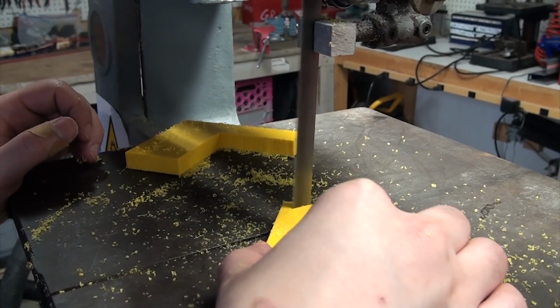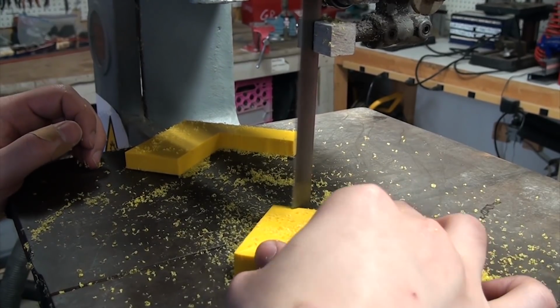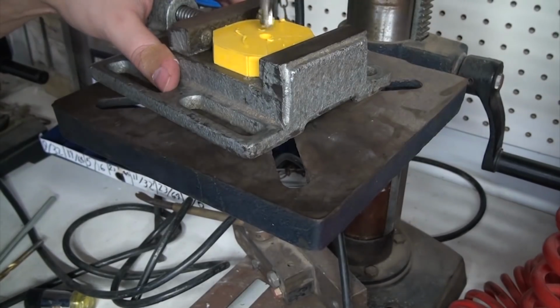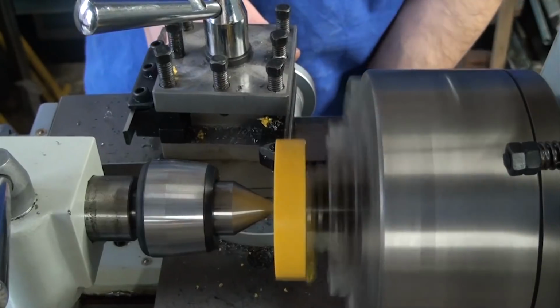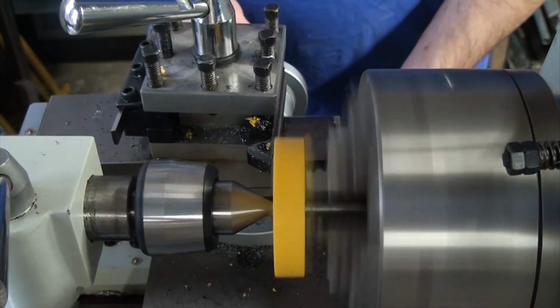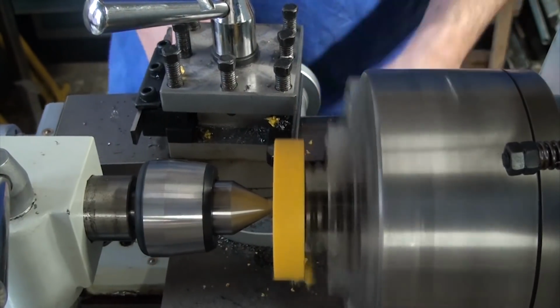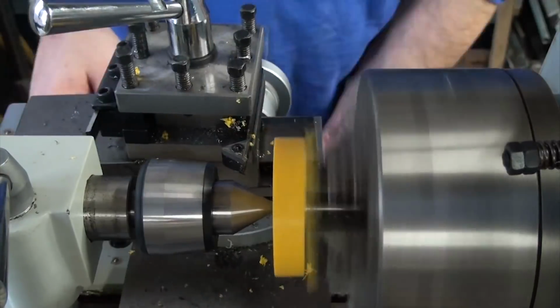For the top plug, I found this block of what I think is Delrin, but is probably some other hard plastic. I roughed out the basic shape and then made a small hole that doesn't go all the way through right in the middle. This is so that I can fit a rod in here to act as a mandrel so I can mount the plastic on the lathe, since I don't have a chuck that could otherwise hold this. With a bit of tailstock support, this was actually very turnable.